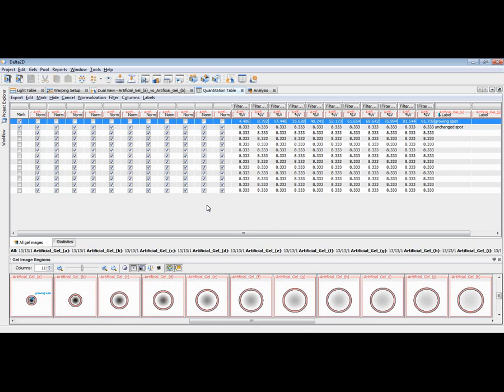Well, now the normalized volumes do not change here because we already have excluded this one from the normalization basis. We only normalize all these spots by the sum of these spots, but excluding the spot that is changing. If we now include this spot, which is changing, in our normalization basis, then in the normalization step, the basis for the normalization is changing because this spot volume is changing, and if it is included in the sum of all the spots, then this factor is changing.